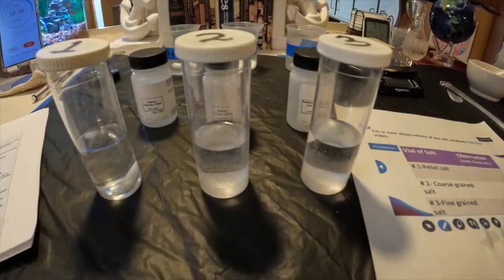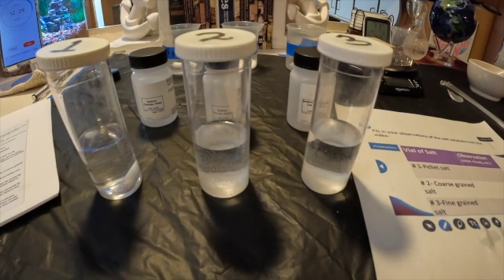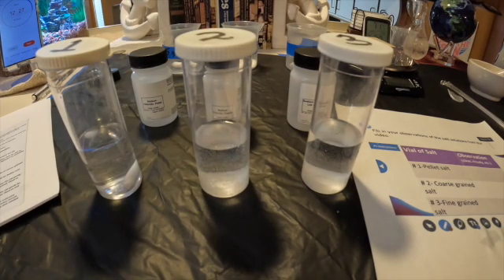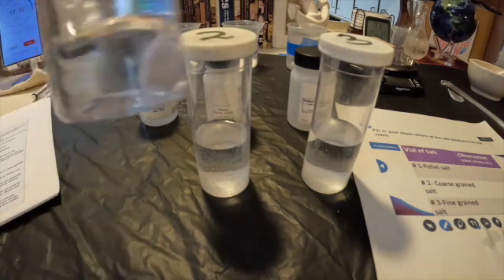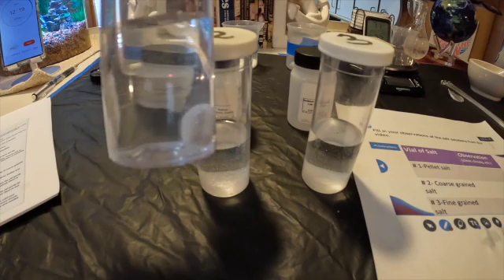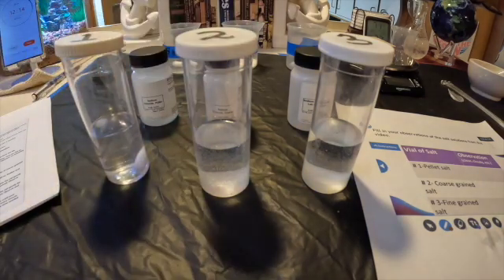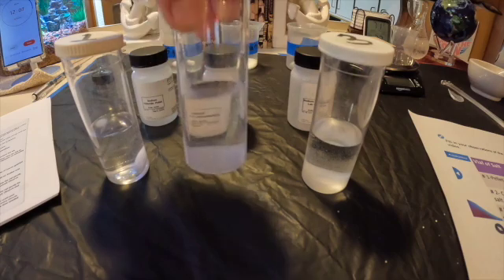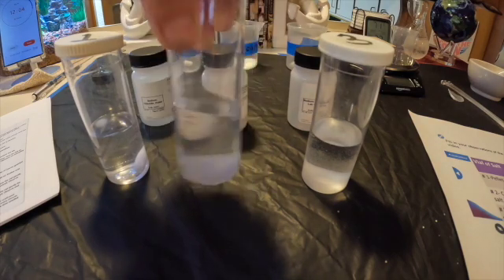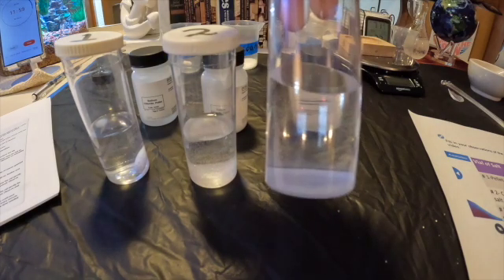It has been 45 minutes and we are back to see our observations on what has dissolved. If you look at vial one with the pellet, this is what it looks like. You're going to record your observations in the chart. This is vial two with the coarse grain salt. And then this is vial three with the fine grain salt.